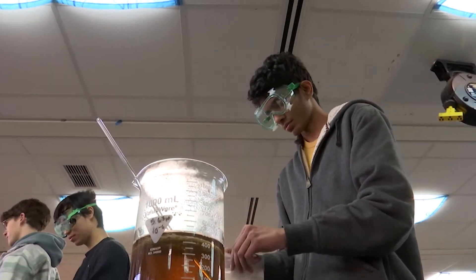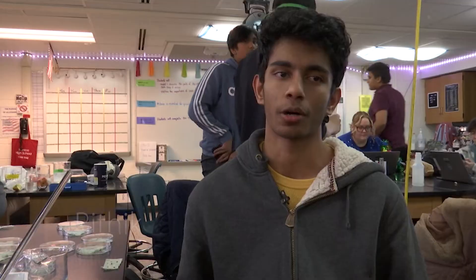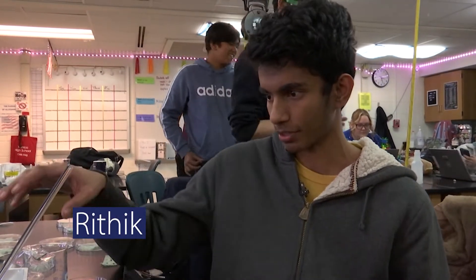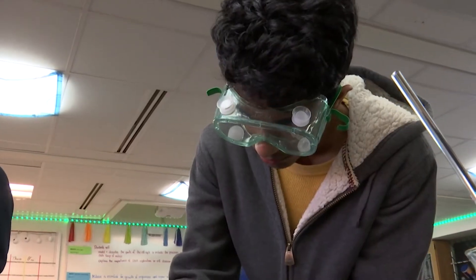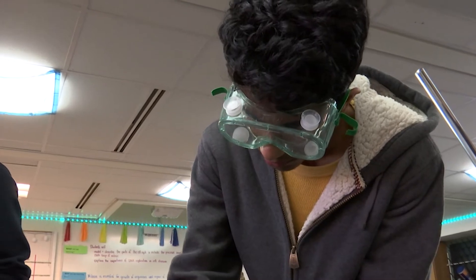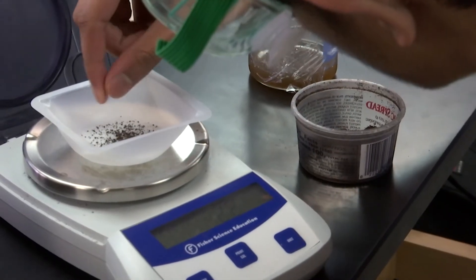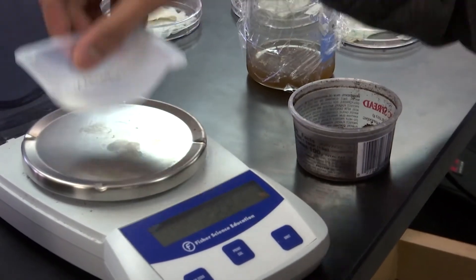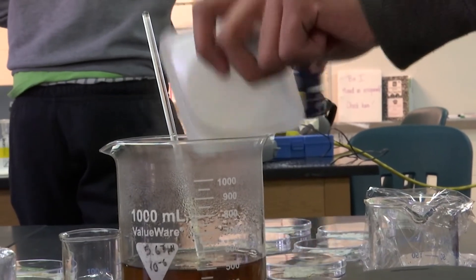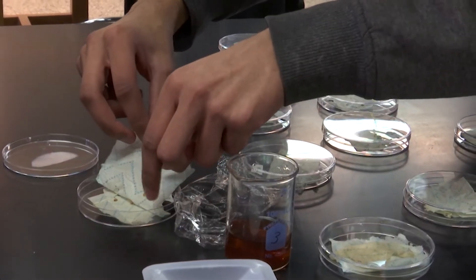I'm measuring whether caffeine can help in the germination of seeds. I'm doing different caffeine measurements for tea — I just made some tea for the caffeine powder to be put into — and I'm going to see if it can affect the seeds of guava, which is an exotic fruit.